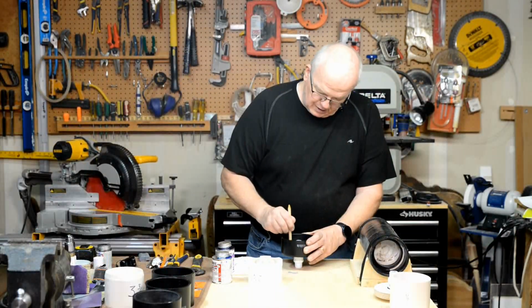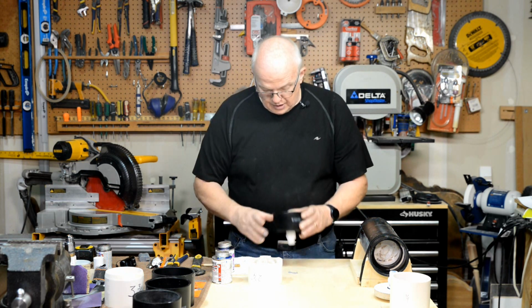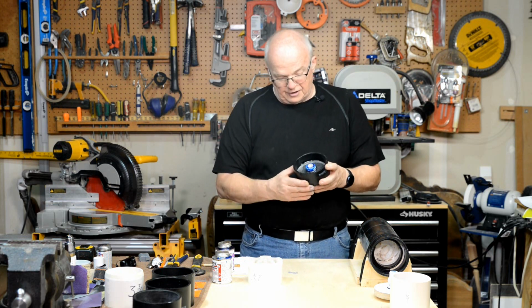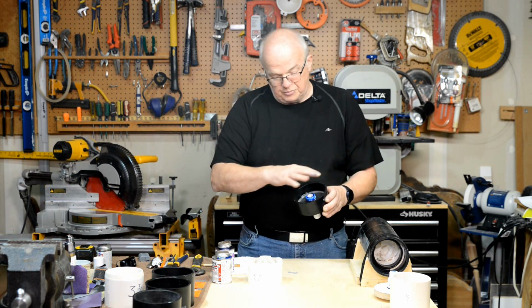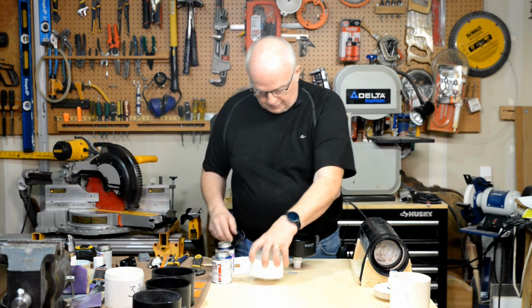Okay, that's been about a minute. So as you can see, now that epoxy will settle down a little bit, but you can see it's completely layered that inside of there. And now we can move right on to the next step from here.